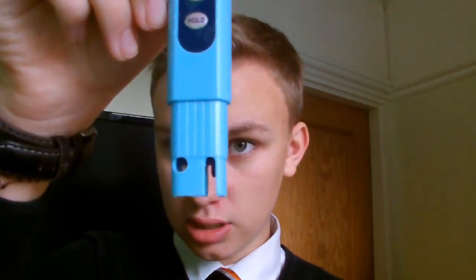Hi guys, it's Ross, hope you're having a great day. Just wanted to do a test of something I've bought. This here is a TDS3 meter — what it does is it measures parts per million in the water by these two electrodes. I thought it'd be interesting; as I've said before, I was looking at making colloidal silver, so I just thought I'd test out the TDS3 meter.